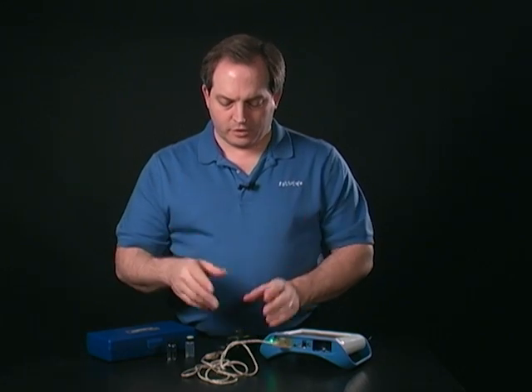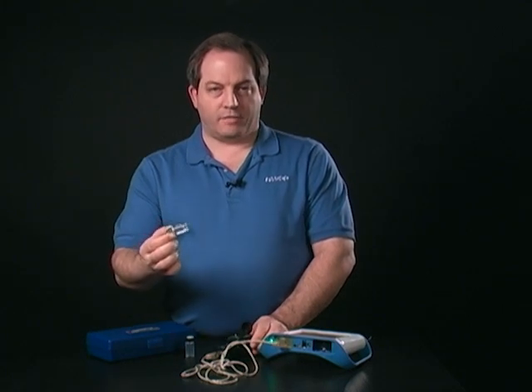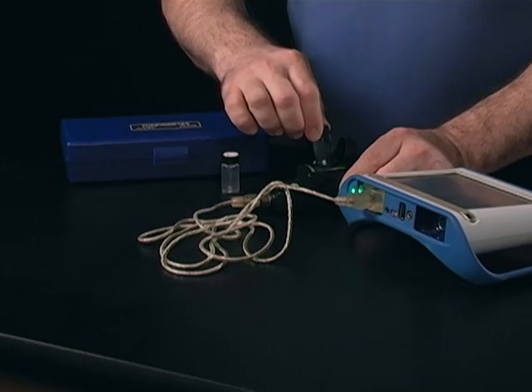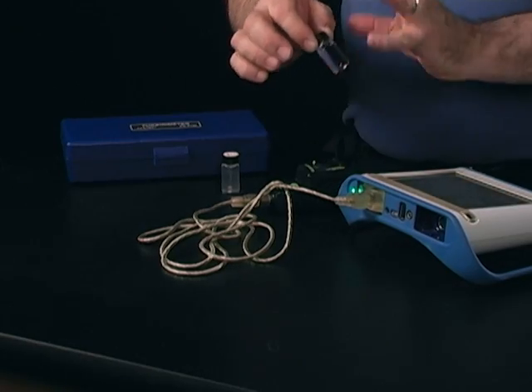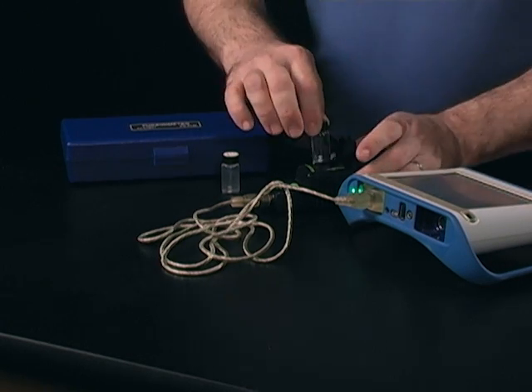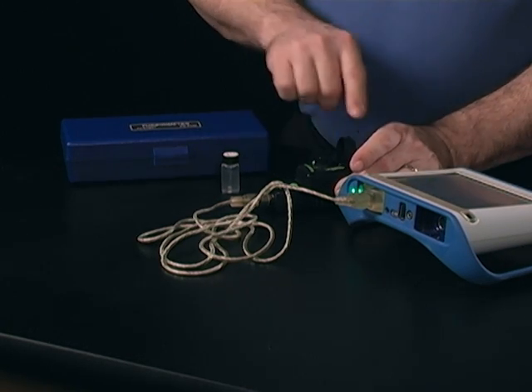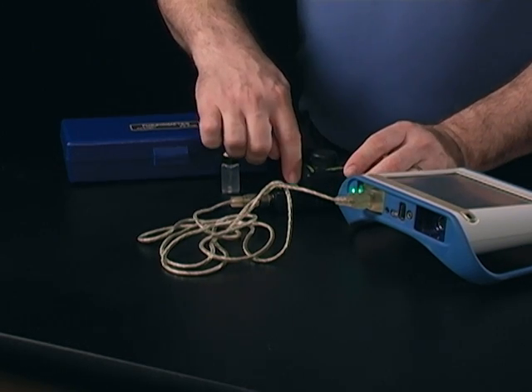To do so, we're going to go ahead and put in a sample of deionized water. We also want to make sure this is all completely cleaned off and there are no fingerprints on the vial. We're going to put that in and press the button.